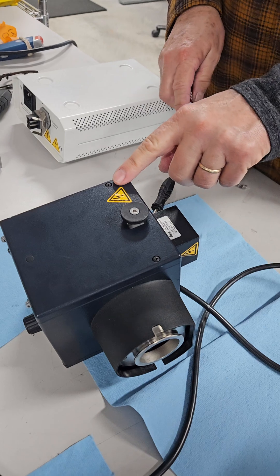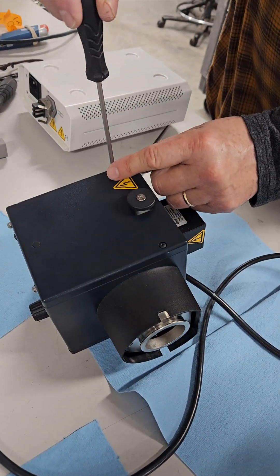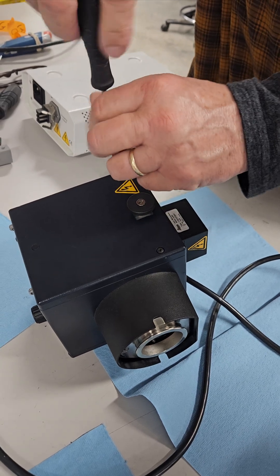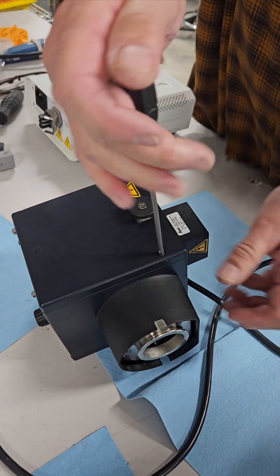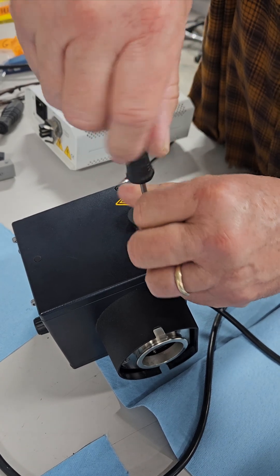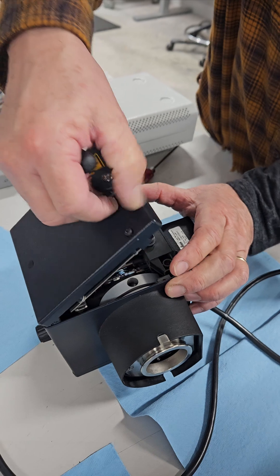On this side there's two Phillips screws and this little plug. Just remove the two Phillips screws on the side. They don't remove, they just back off.